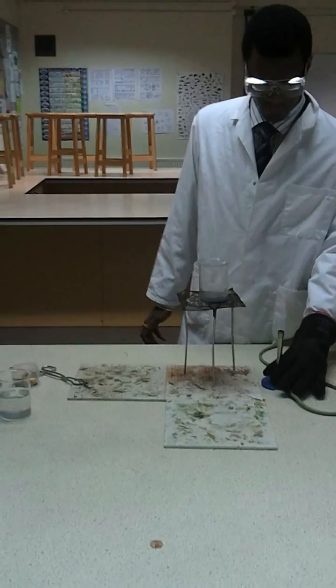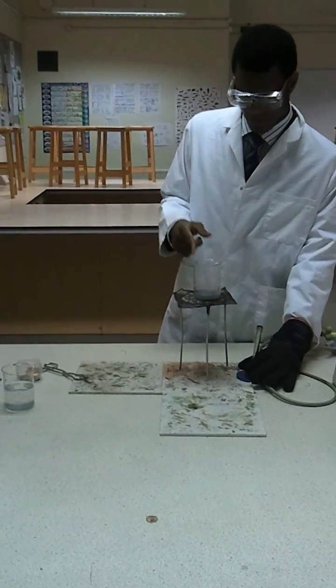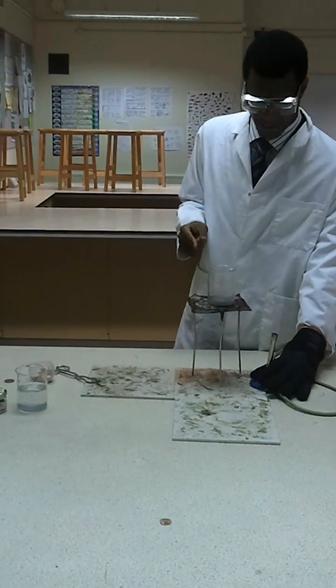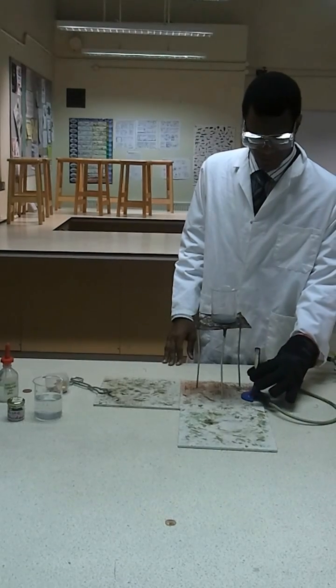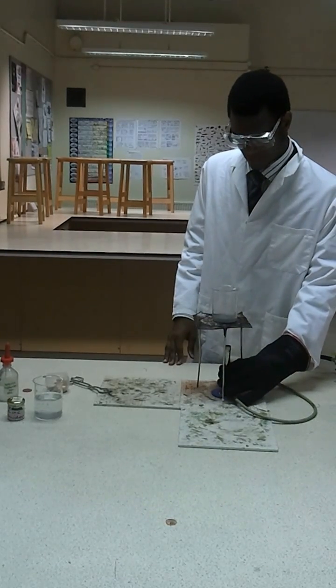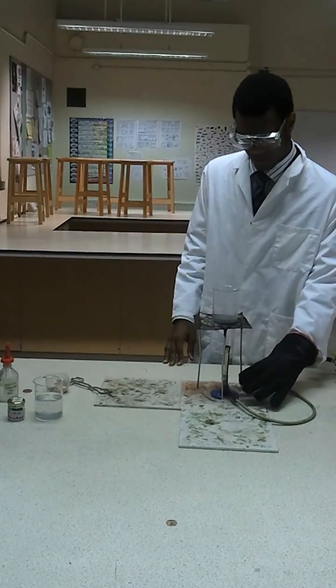Okay, so I've got sodium hydroxide and zinc powder inside a beaker, a Bunsen on a roaring flame. Put it underneath and bring it to the boil.